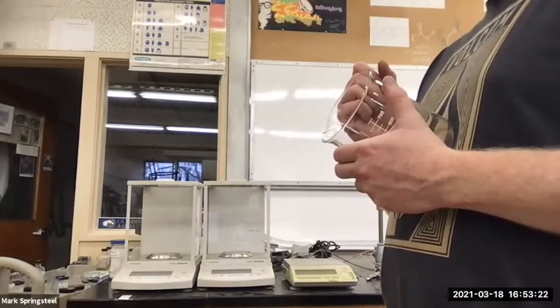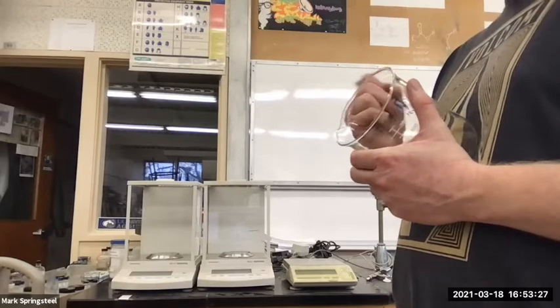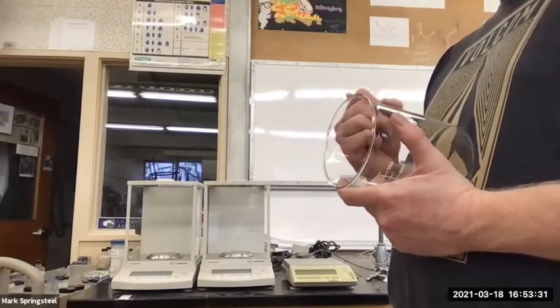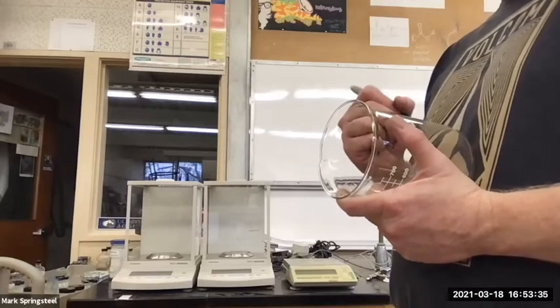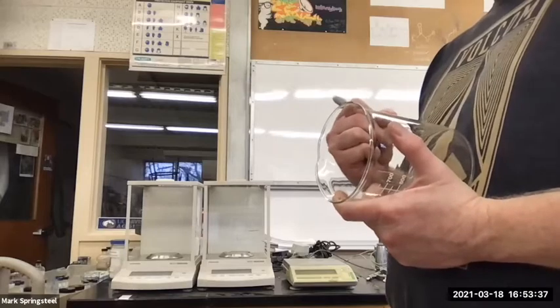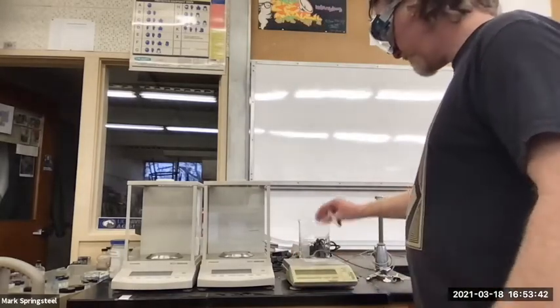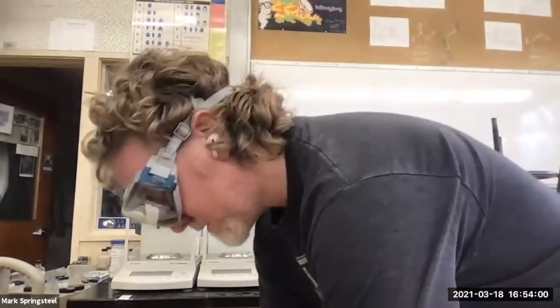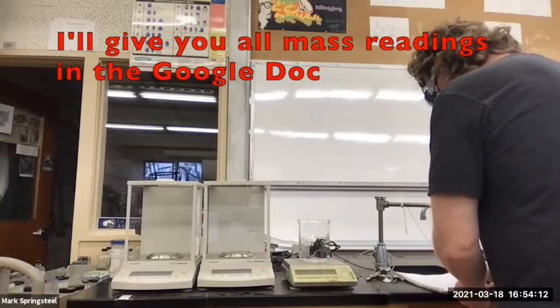So I'm going to initial this MS 381. And this is my unknown extraction, organic layer. Okay, so this is reading 0 currently. I'll put that on there and see what it says. Well, I haven't been writing down. So evaporation beaker, 256.94 grams.